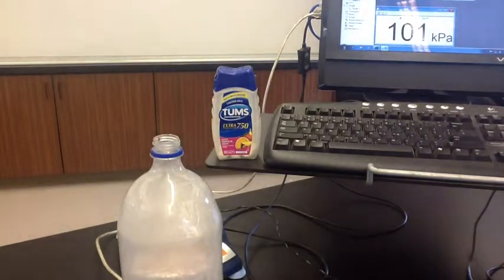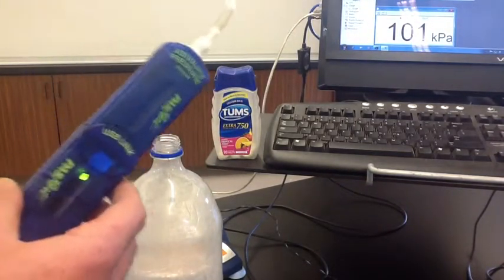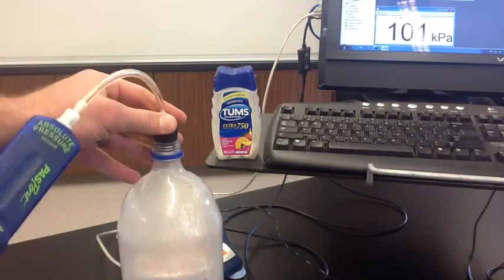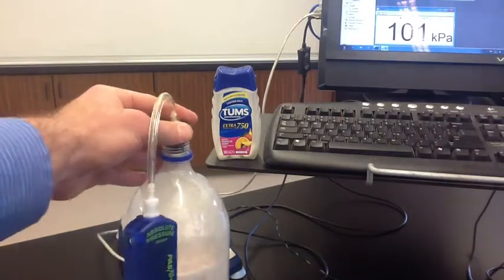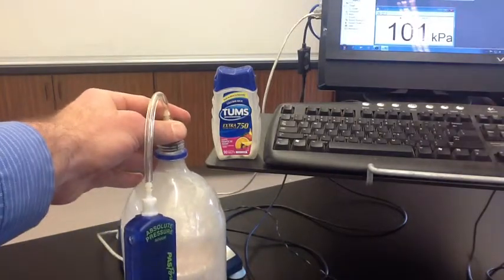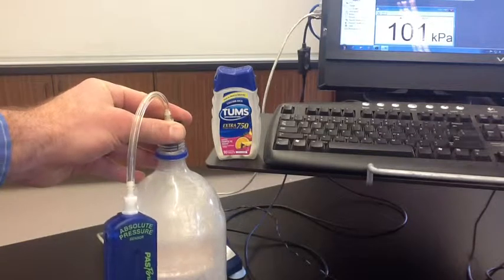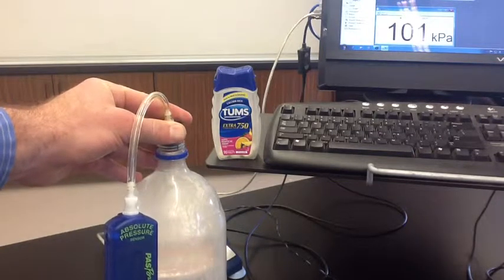We're going to use our pressure sensors — we hook them up to the bottle right now. And you can see on the computer screen that the original pressure inside this bottle is 101 kilopascals.